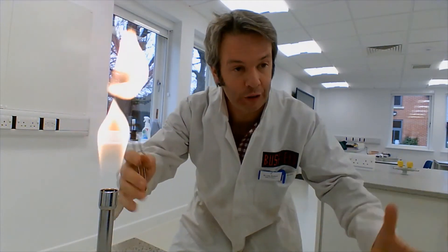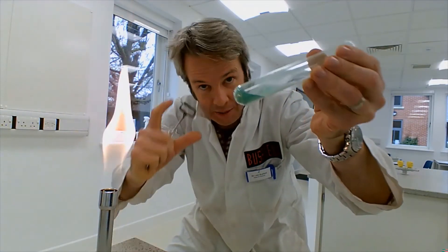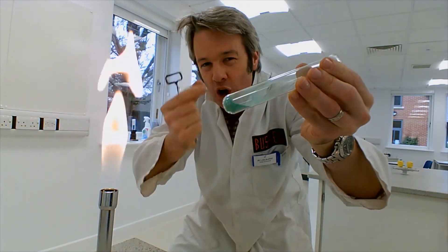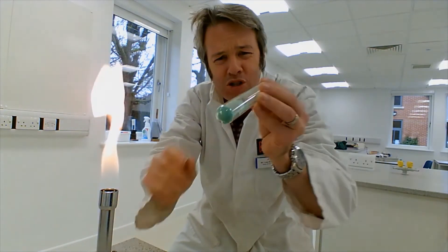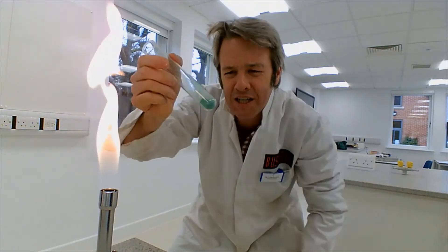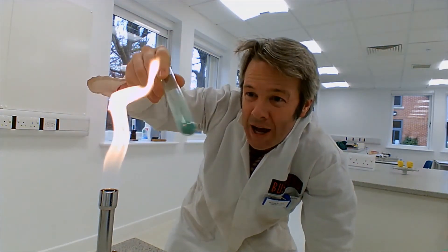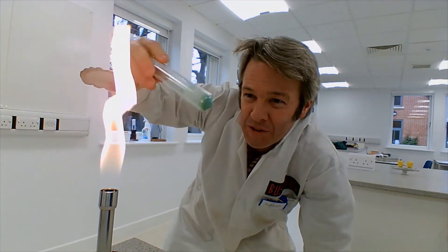Welcome to the lab — it's obviously locked down due to COVID, so you're not physically here but I am, which means I can show you this. Here we have copper carbonate, that's Cu for copper, CO3 — so CuCO3. Copper carbonate is this beautiful green colour. Have you ever seen a house with a copper roof? The copper roof eventually goes green because it reacts with carbonic acid, which is just water with carbon dioxide dissolved in it.